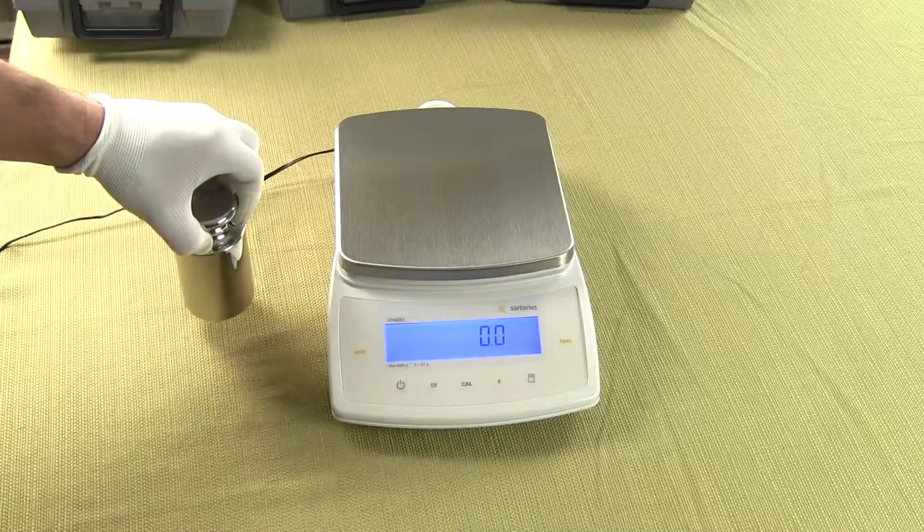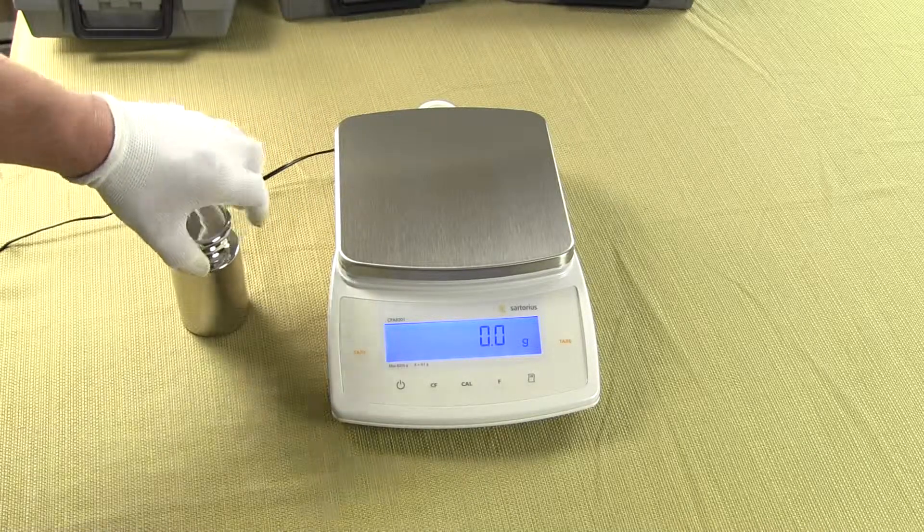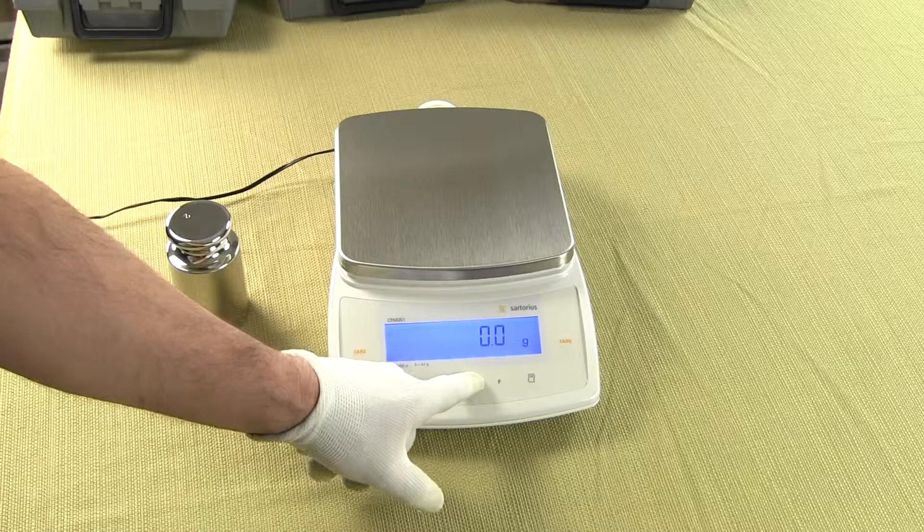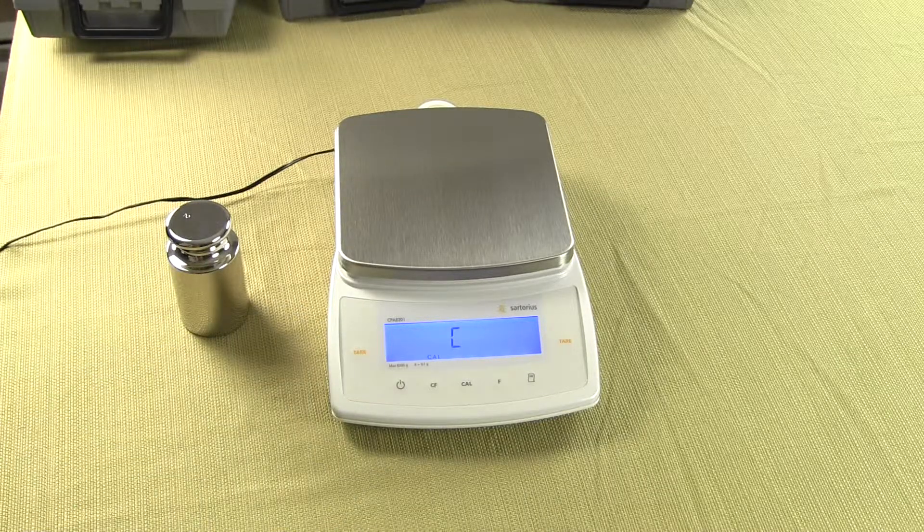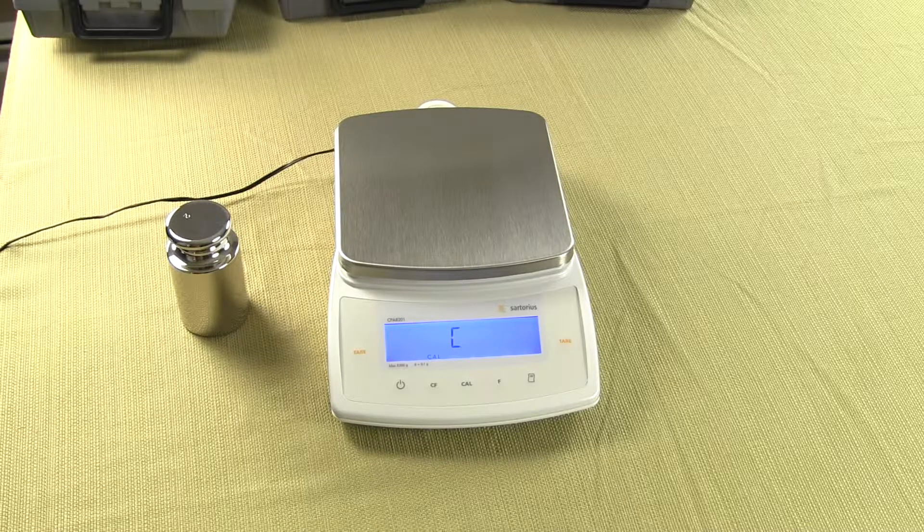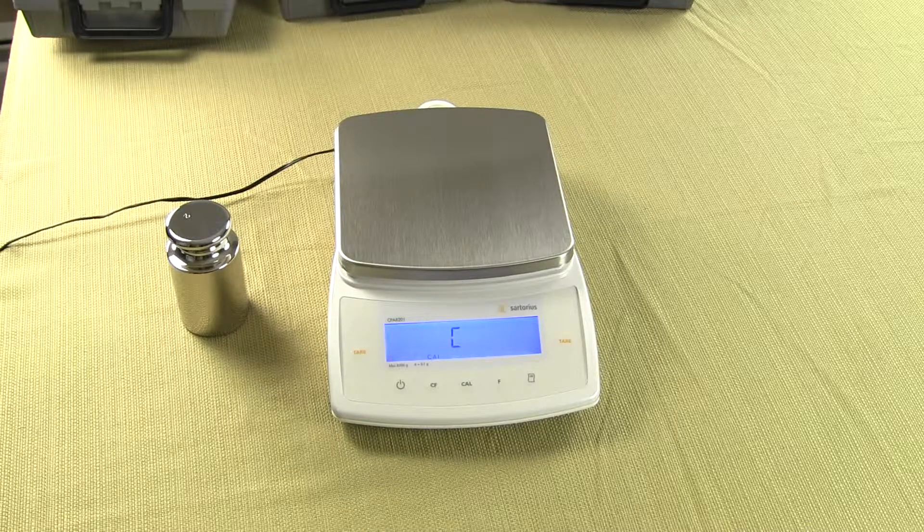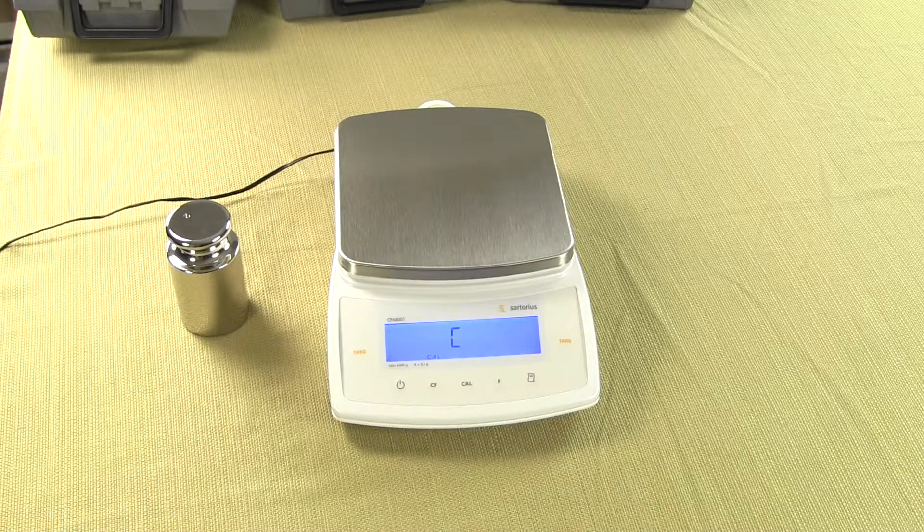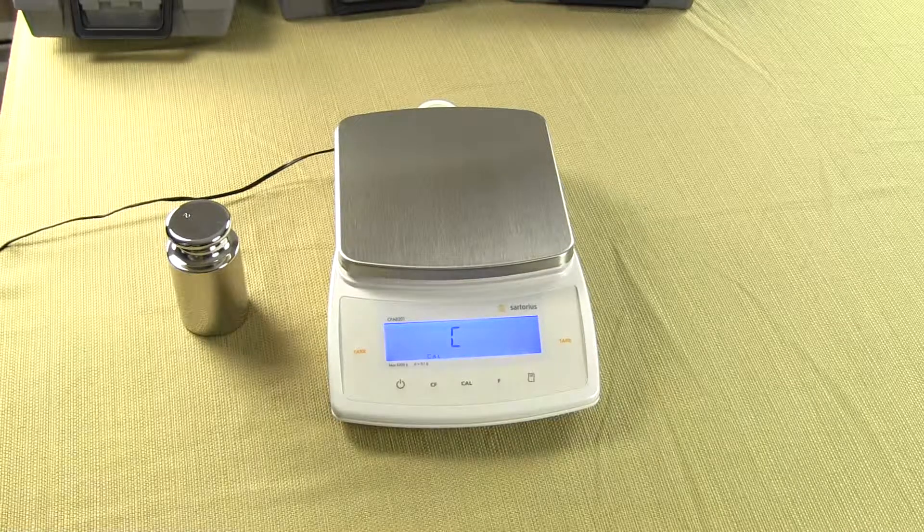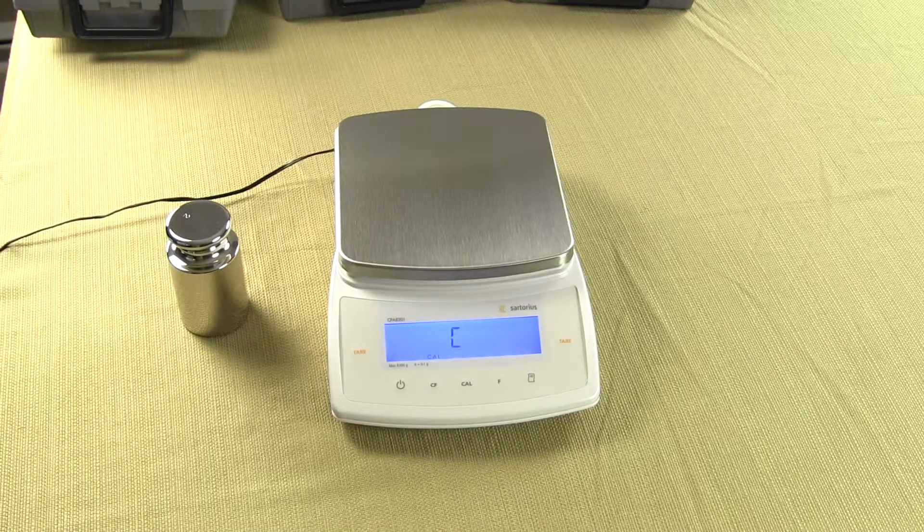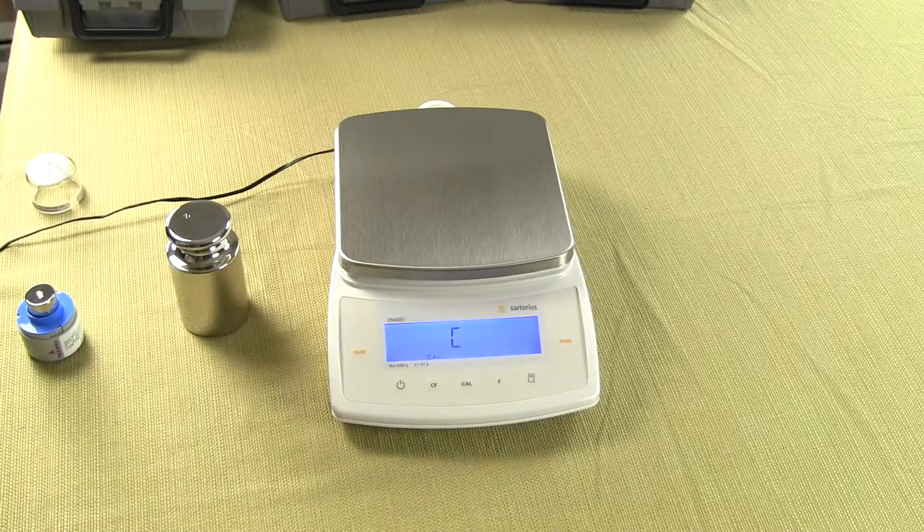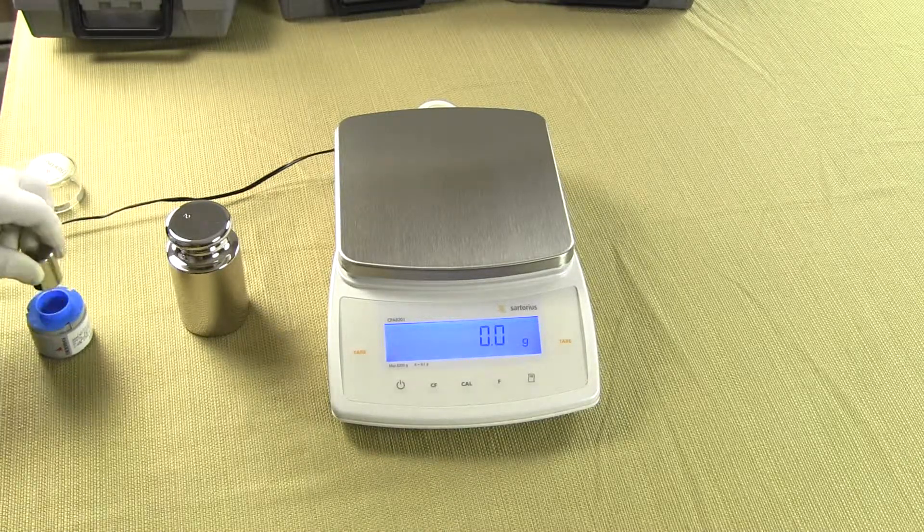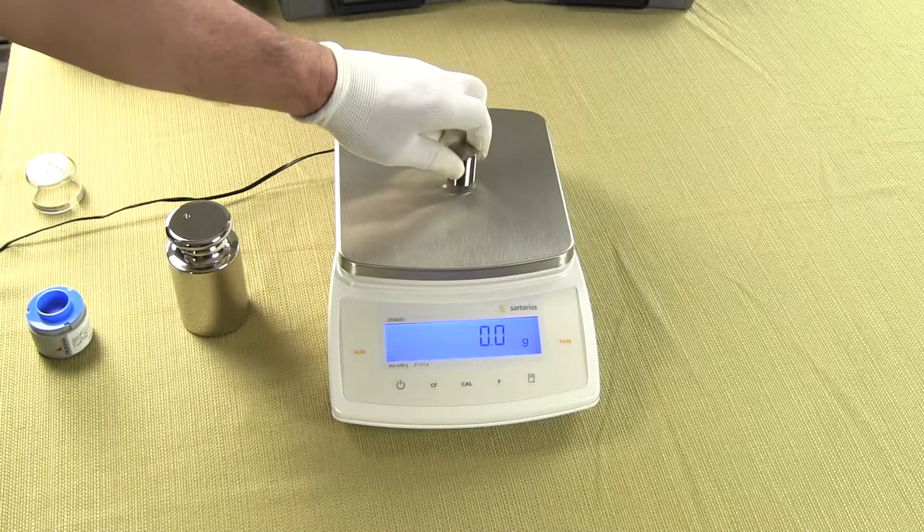This balance has motorized internal calibration. One simply presses the CAL key and we'll hear the servo motor drop the weight. The balance has now performed the internal calibration.